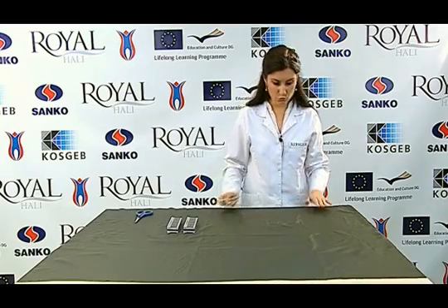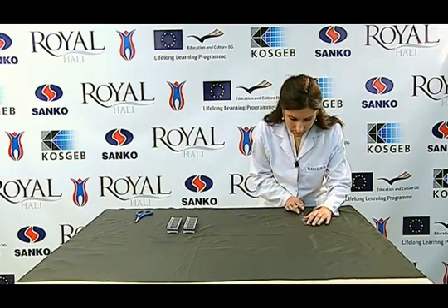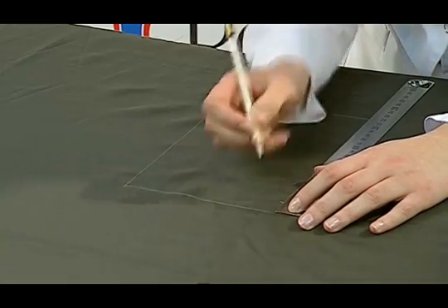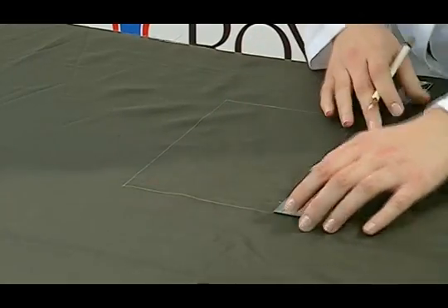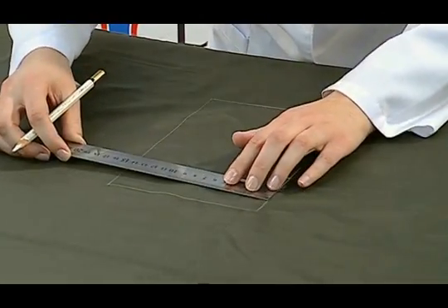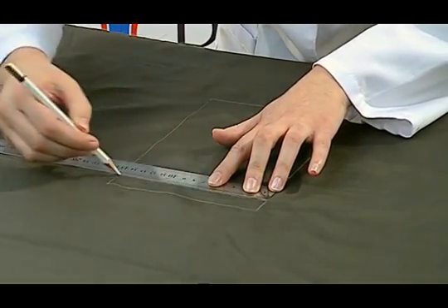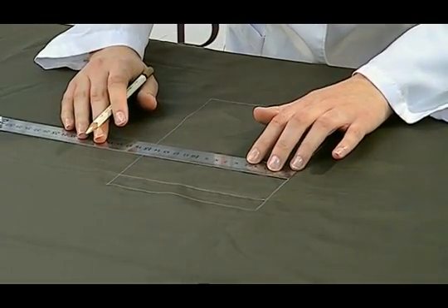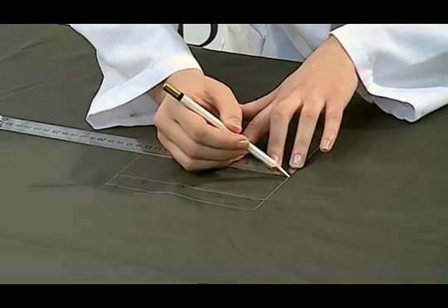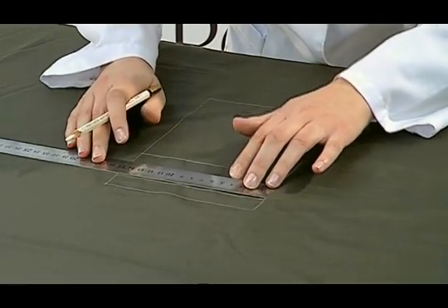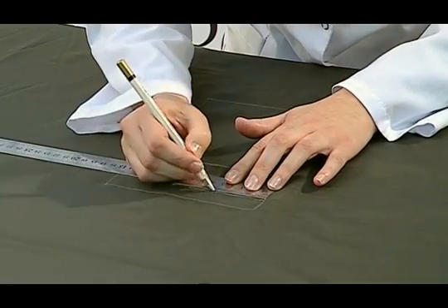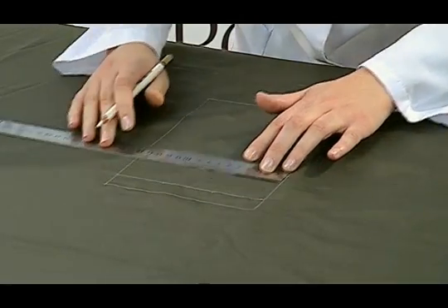Rectangular samples on which we prepared points 20 mm and 70 mm from the long selvage are marked and lines are drawn parallel to the short side. 50 mm are marked on the spots we have drawn and these lines are divided into three equal parts.